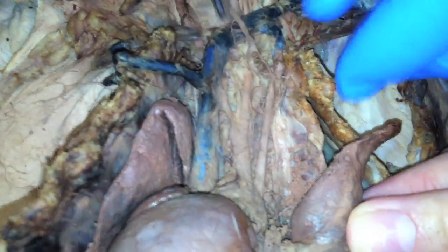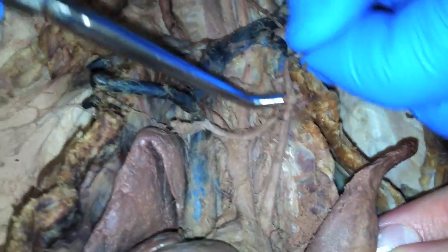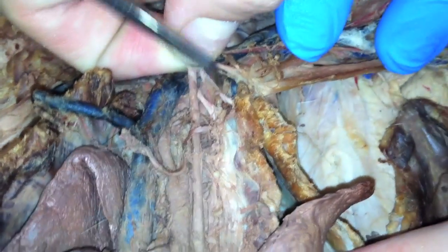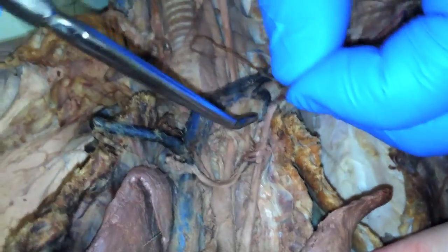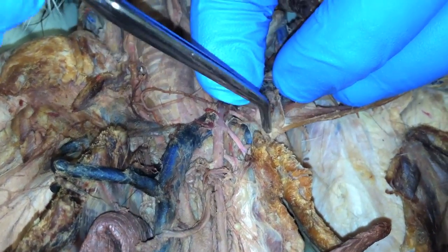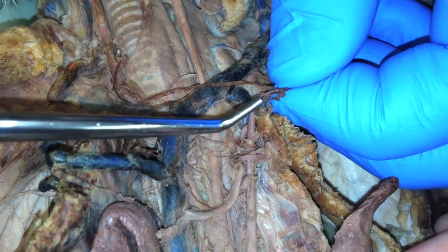So this is the subclavian. You have three branches on the bottom. The first one is vertebral, the next is costocervical, and thyrocervical. And then three branches: vertebral, costocervical, thyrocervical. And across from the costocervical is the mammary.